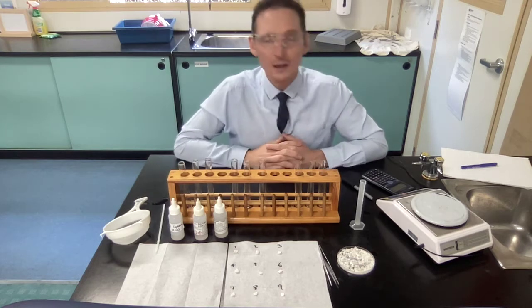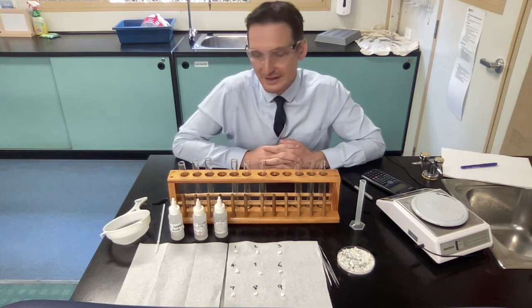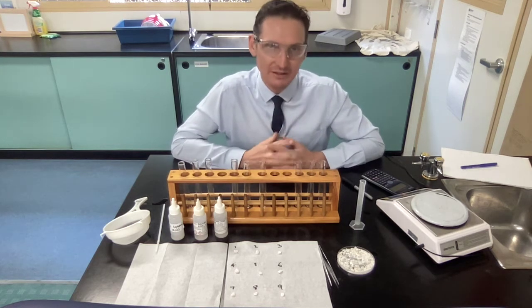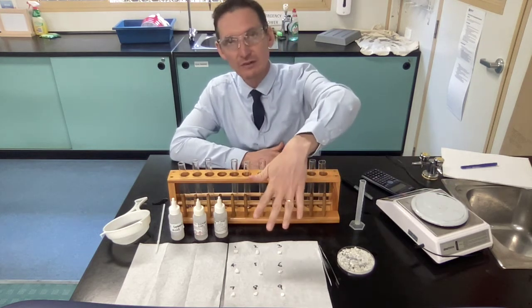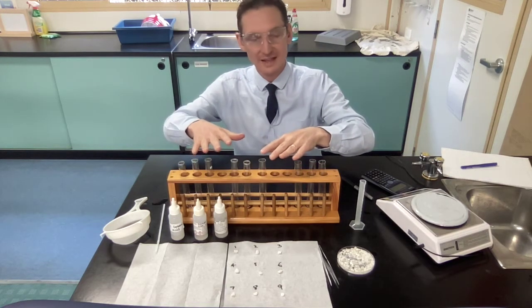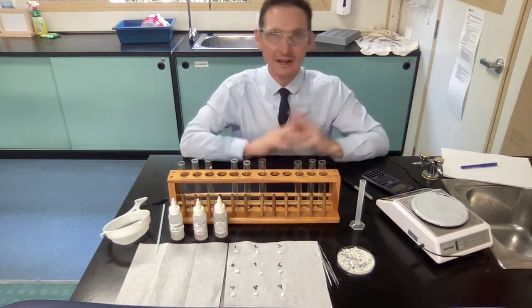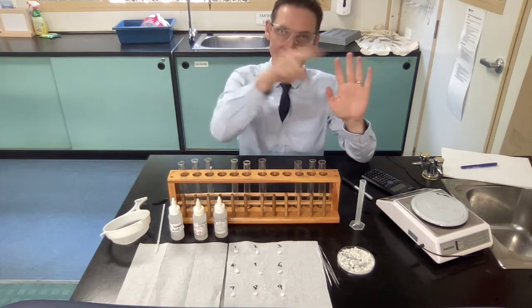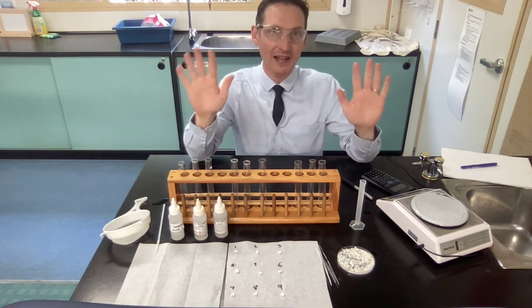When you weather things, you remove some of the rock. You break it down, and we're going to chemically break it down today. So in order to measure how much that gets broken down, we're going to use our scales over here, measure each of our 9 rocks first, then weather them chemically using acid, and then we're going to dry them off and re-weigh them, and then we get a mass before weathering and a mass after weathering. The difference in the mass from before and after will tell us how much weathering has occurred.